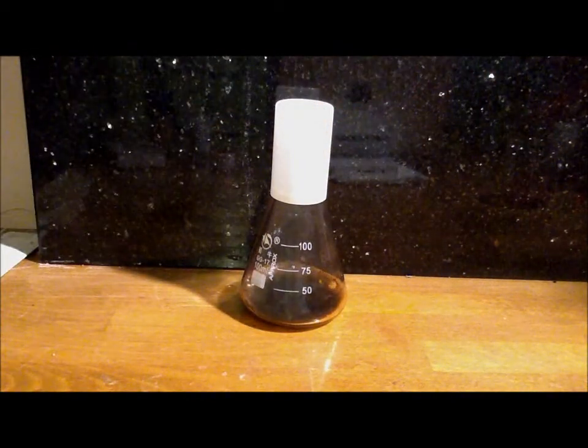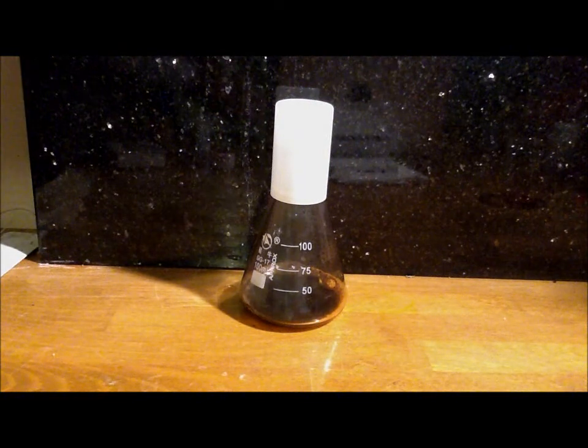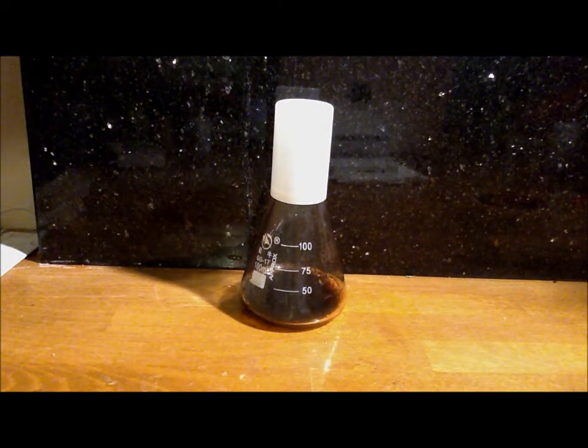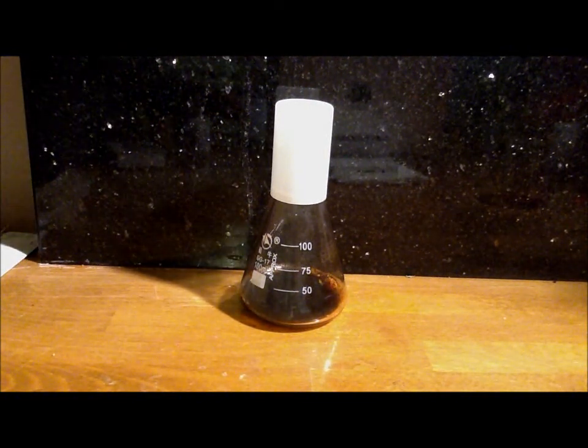Put the cap over it and you have a nice storage of oxygen in there already.